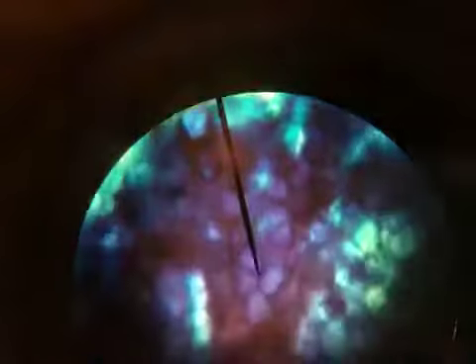Okay, and now if we go up to 40, which is as high as we go on this microscope, slowly click it into place. There's my 40, and I can use my fine focus to look at the different features, and then I can move my platform around slowly.